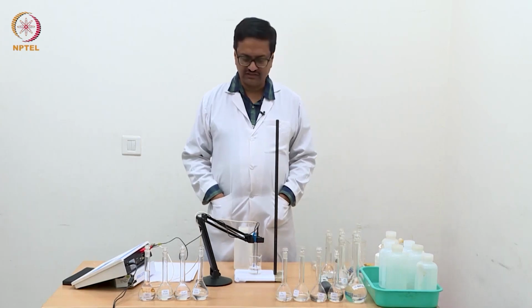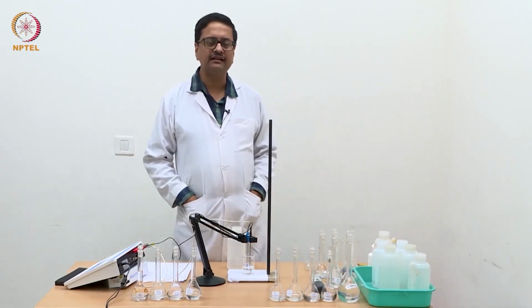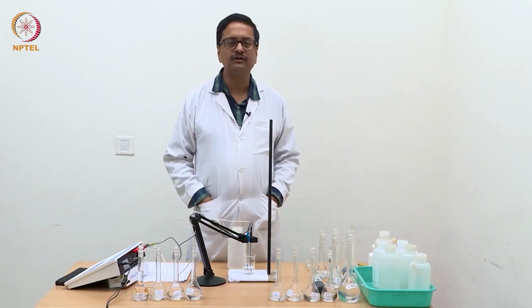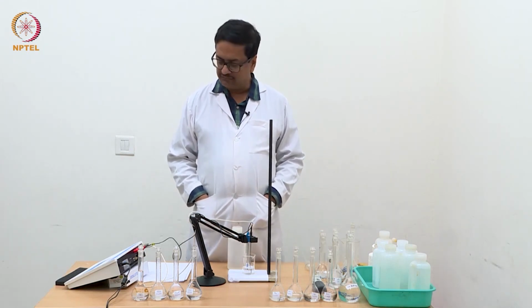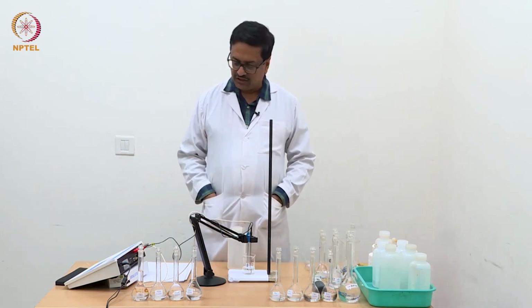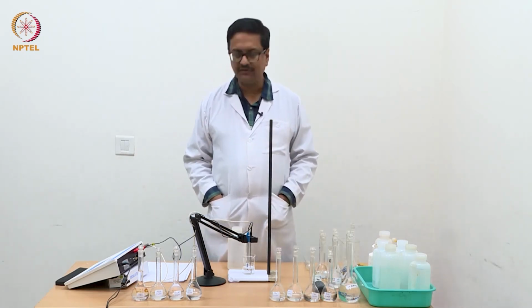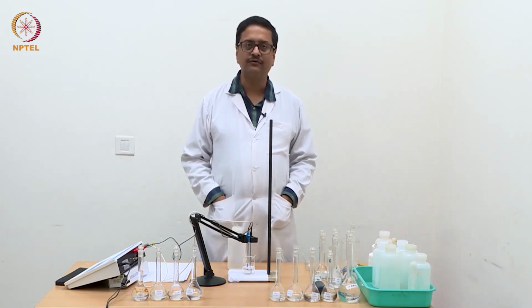Welcome back to this demonstration of experiments for elementary electrochemistry course. And in the previous video, we have demonstrated the measurement of conductance of a series of HCl solutions starting with concentration N/256 normal up to N/4.